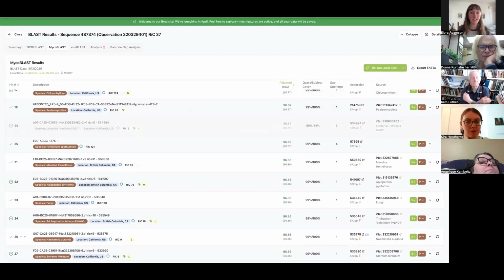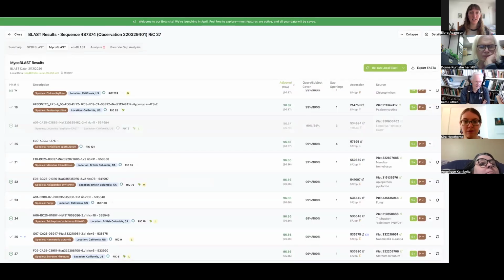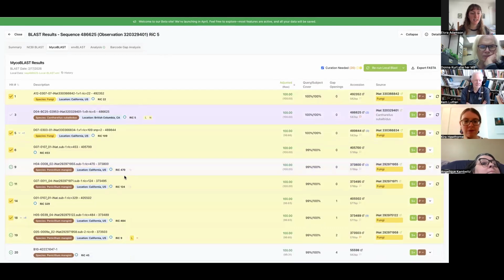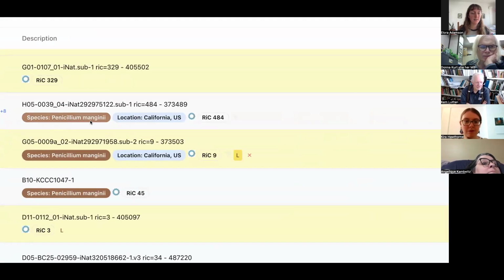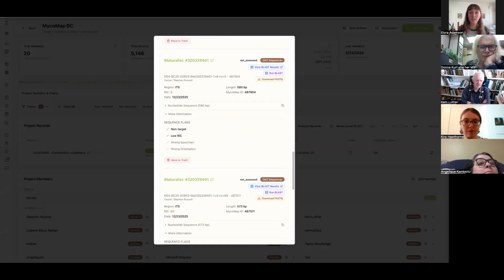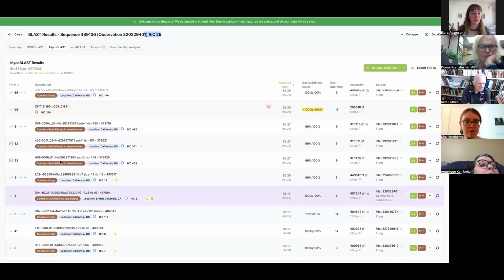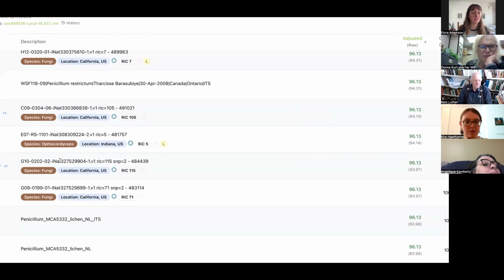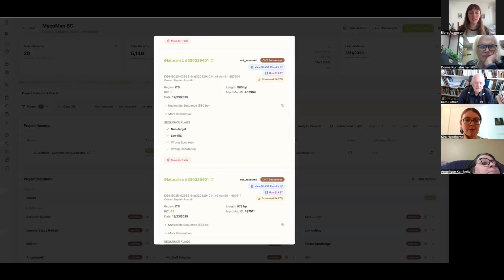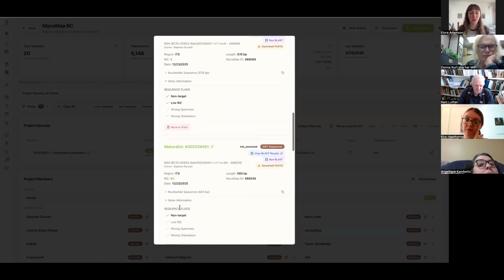Okay, so we're getting down to the nitty-gritty here. Non-target. 5 reads right away. Penicillium, non-target. Okay, what was the first one that I ignored because it was kind of low? Non-target. All right. So we had 9 sequences and 0 of them are on target. So we've done our due diligence now. We've marked all of them as non-target.